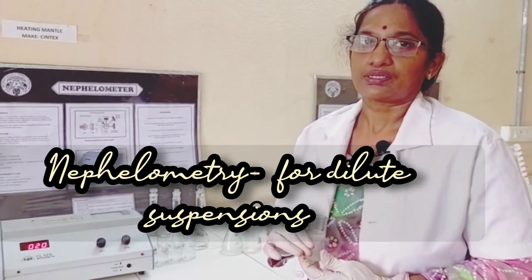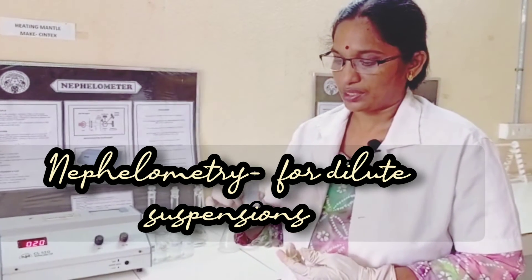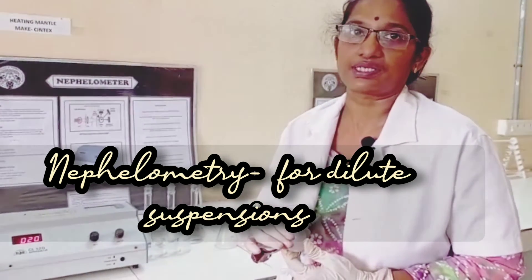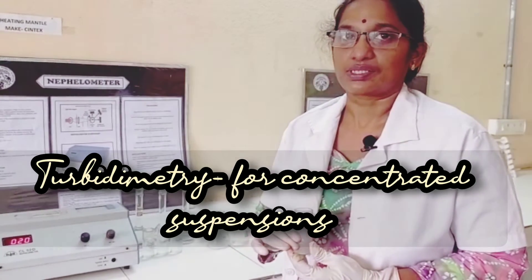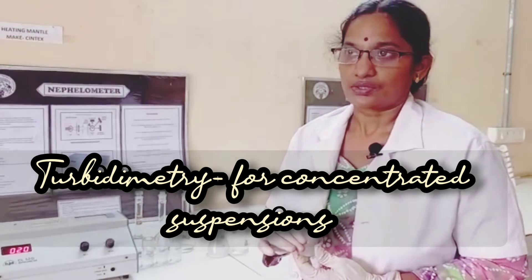Nephelometry is used for dilute suspensions. Today we are estimating a very dilute barium sulphate solution using the nephelometer. Turbidimetry is where we can estimate concentrated suspensions.